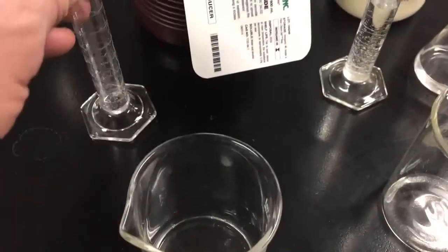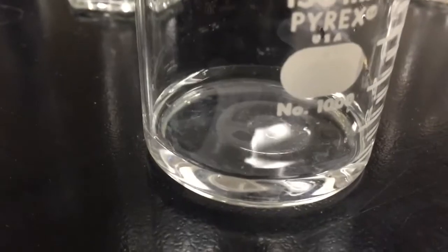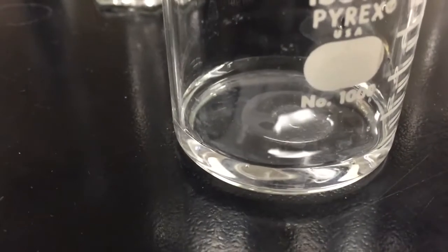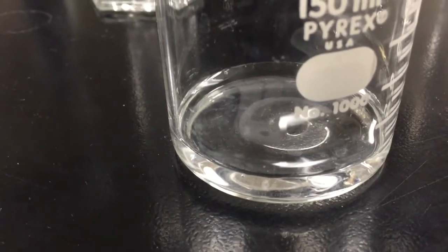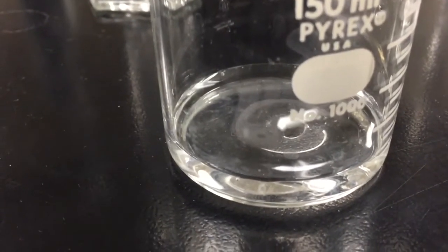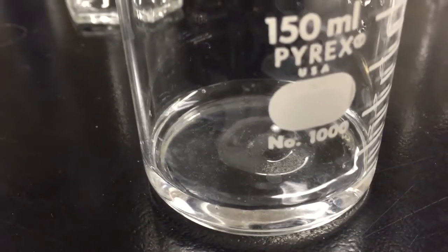And the hydrogen peroxide molecules actually react with each other to decompose, and they form water and oxygen gas. Now you can see that not much oxygen gas is being formed right there. It's a very, very slow rate because the activation energy is very, very high for this reaction. So if I could lower the activation energy, I can speed up the rate of that reaction.